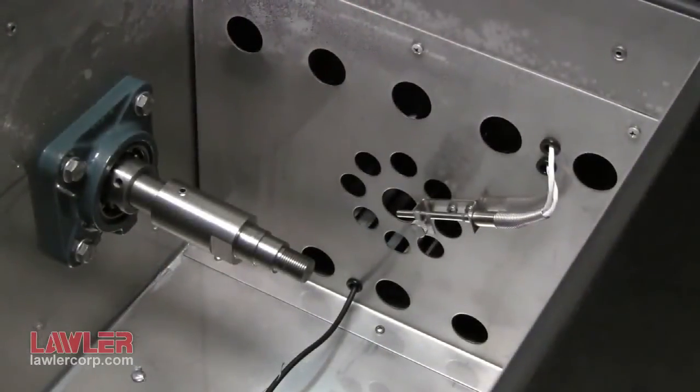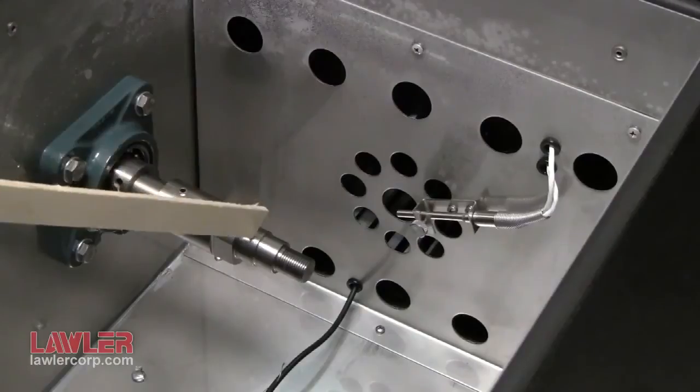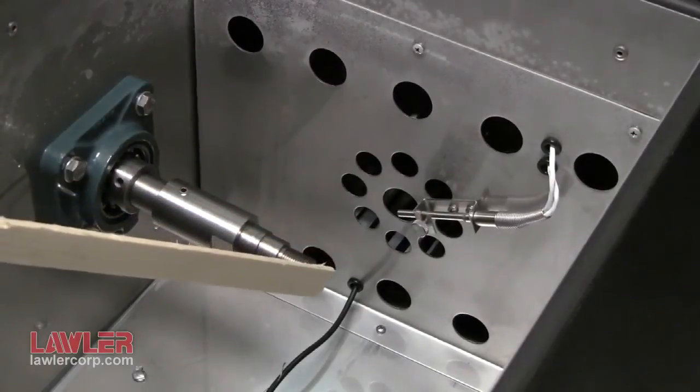We have the shaft itself for the motor, and it's going to be set up for D1478 shortly.